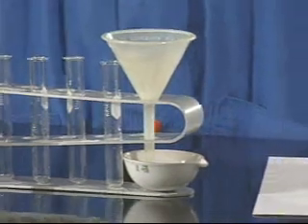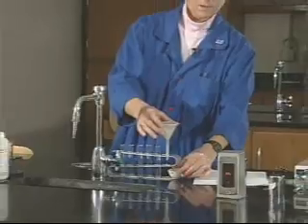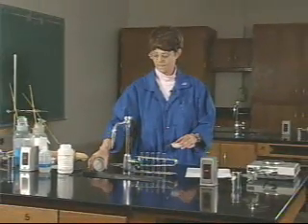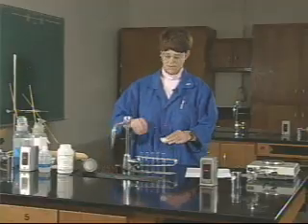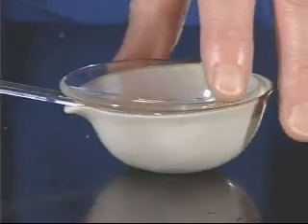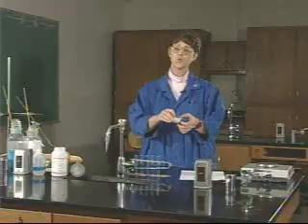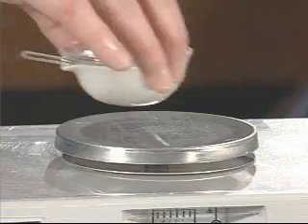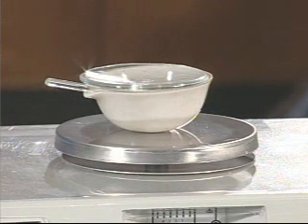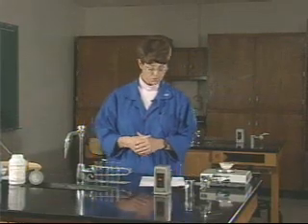After most of the liquid has filtered through the funnel, you can remove the funnel and then take the evaporating dish. Put the stirring rod in and the watch glass on top, which is the way you had it when you weighed it the first time, and then you want to re-weigh. Zero the balance, determine the mass, and then record the mass on your report sheet.